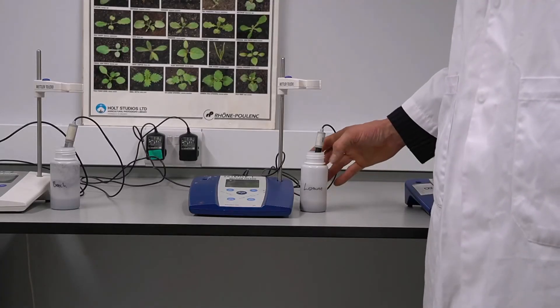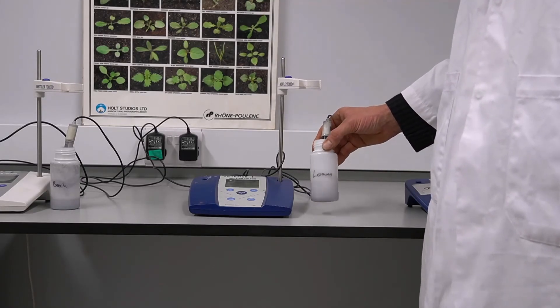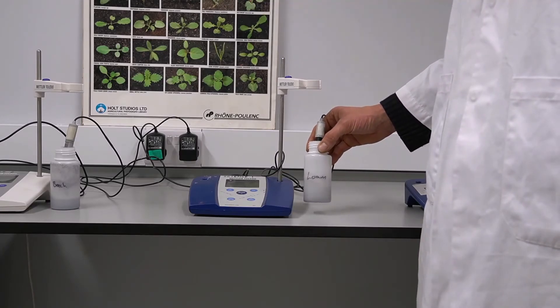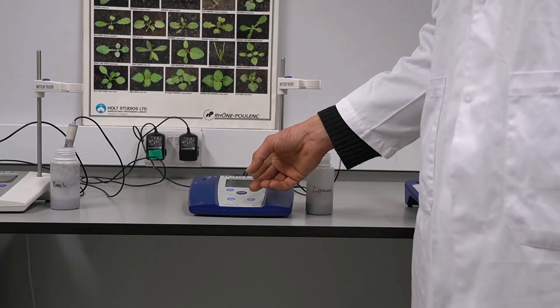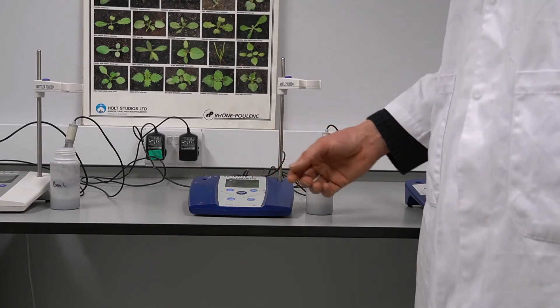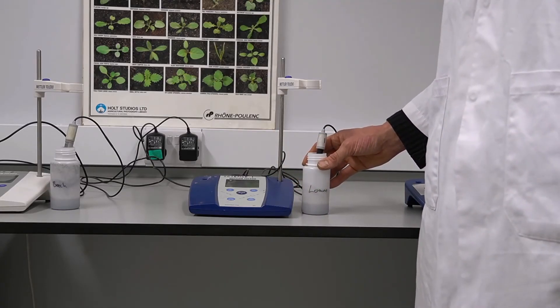This is the loamy soil from a field near my university. It has an even ratio of sand, silt, and clay. As you can see, this is a much higher pH — even into the alkaline at pH 8. This is because of the calcium deposits in the soil that raise the pH to above neutral.